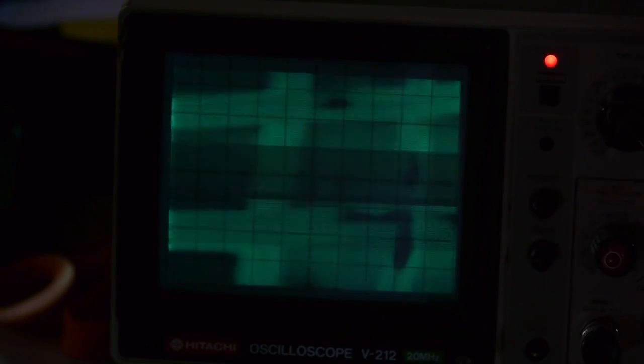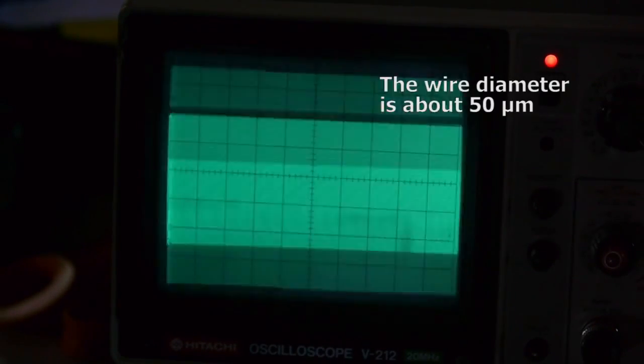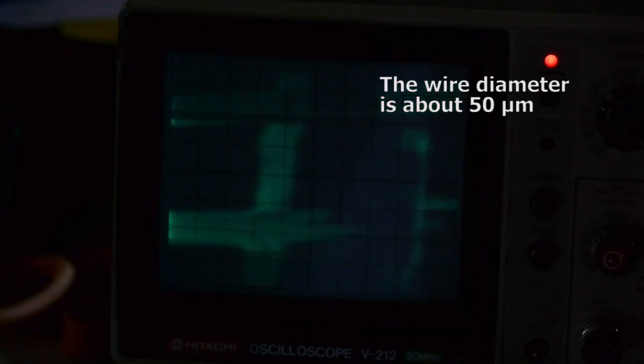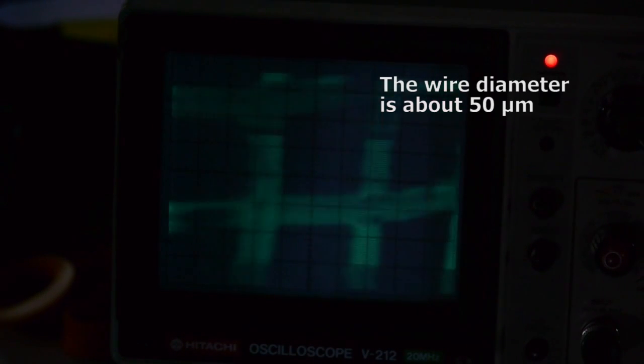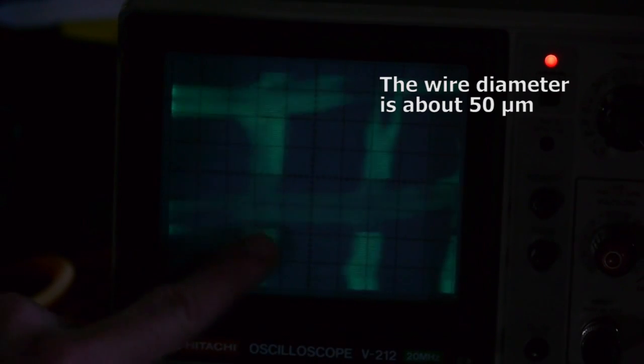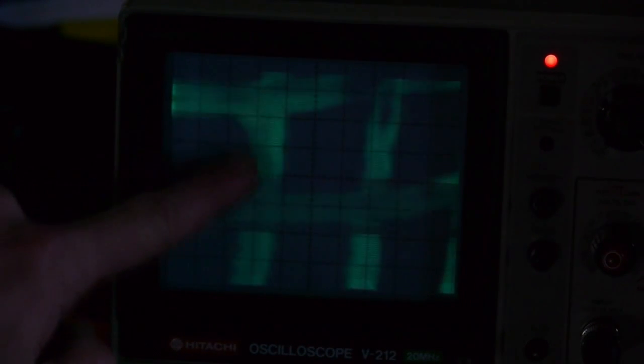So we're in pretty close now. I'll do some measurements on that copper mesh screen so that we can kind of get an idea of how close we are. You can actually see the weave pattern of the mesh so this wire is going on top and this wire is going underneath, so it's woven like a fabric. And there's still some residual noise in the image. There's kind of this wavy pattern here, but we're at pretty high magnification. See if we can go a little bit higher. Up to five kilovolts acceleration now.